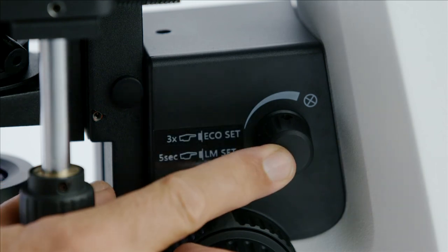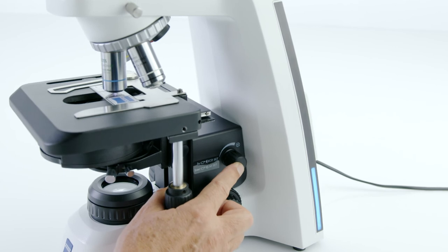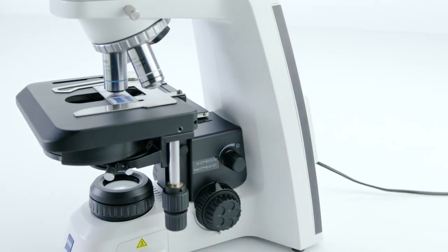When you're done, use the same process to deactivate the Light Manager. Just push the Light Intensity knob and hold it for 5 seconds.